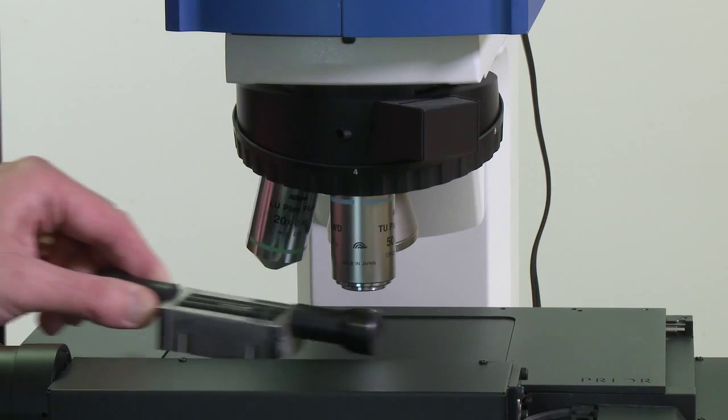And if the sample is curved or tilted, then not only will the n-gauge still give you the right answer despite that tilt or curvature, but it will also enable you to measure that tilt or curvature directly and so learn something about the actual sample morphology. In the next couple of minutes, I'm going to show you how it works, so let's take a look.